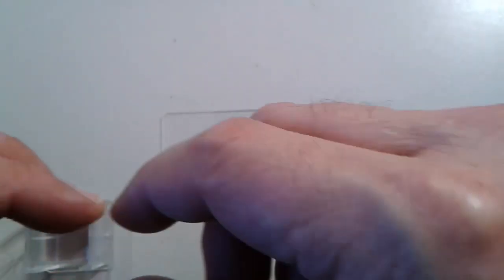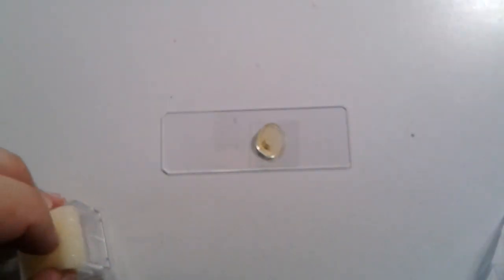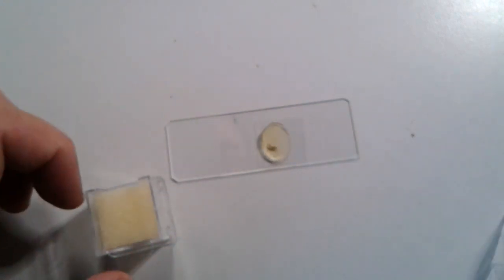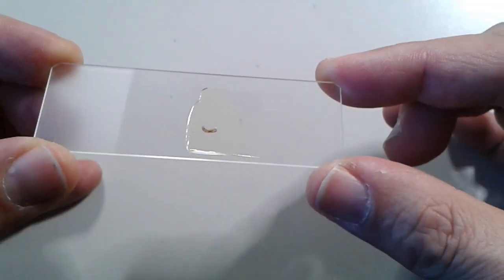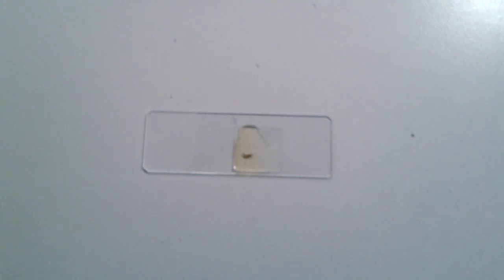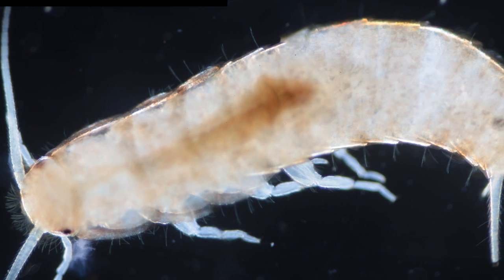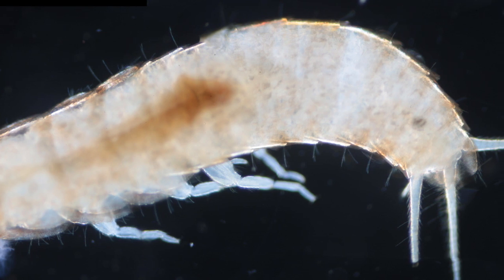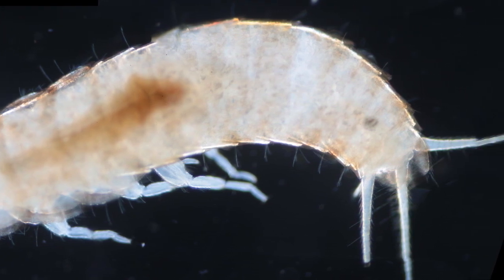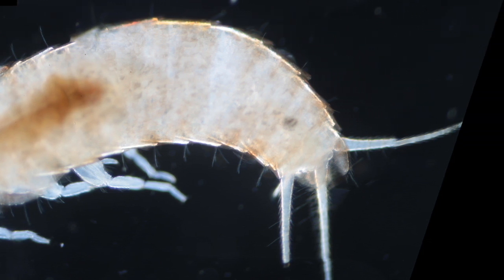A small cover glass, and then it takes around a month to six weeks for the mounting medium to dry. This is also the time needed for the mounting medium to actually enter the specimen and infiltrate the insect, and this process also clears it up a little bit. This is now a dark field image — I stitched together a few images. You can see it looks quite nice; there are a whole bunch of segments, very typical for insects or arthropods in general.